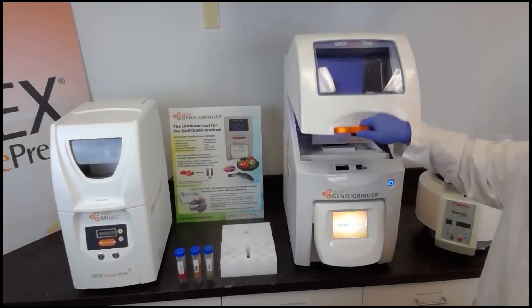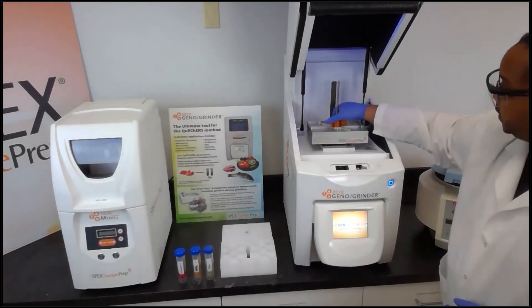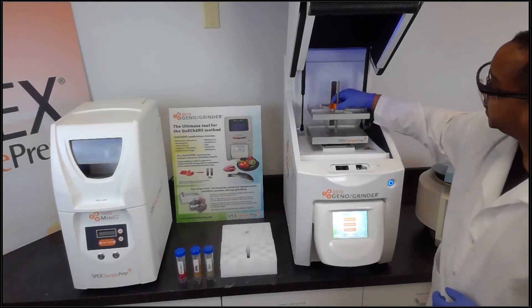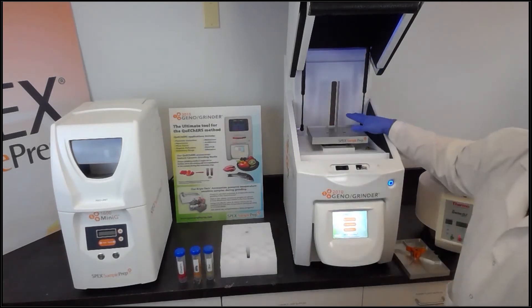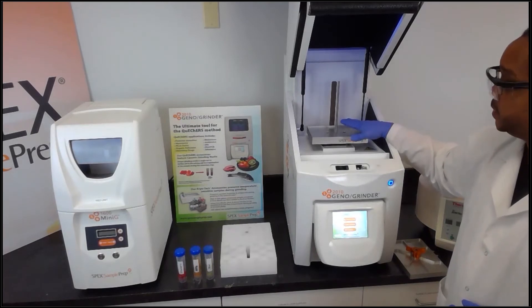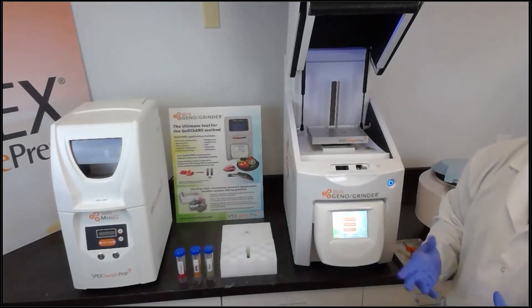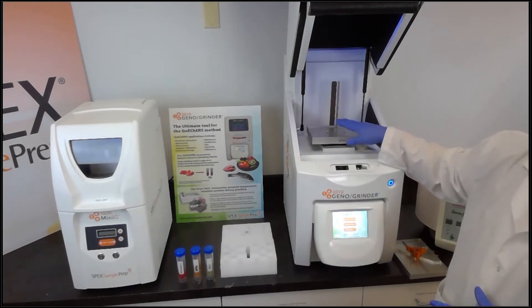To get to the sample area, you simply raise the lid. Here we have a clamp with a quick release knob — you press the button and hold, then slide off the clamp lid. The nice thing about the clamp is that it can accommodate a variety of different sample containers, from 50 milliliter tubes to titer plates to larger jars and small vials.